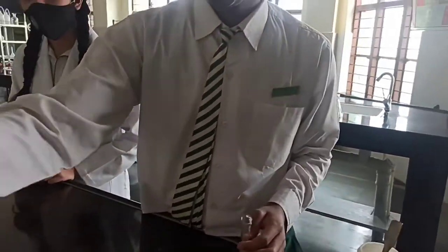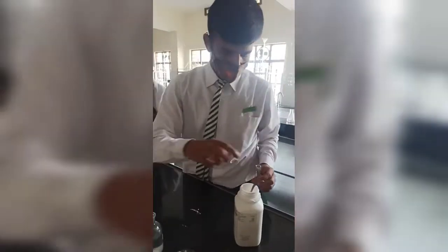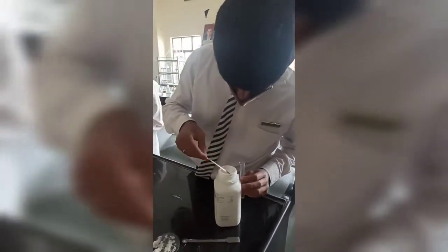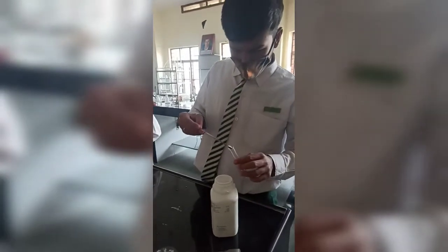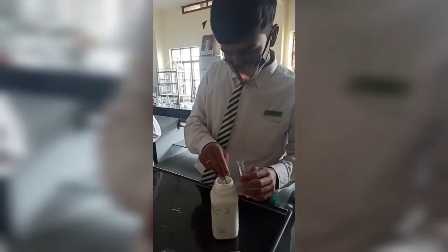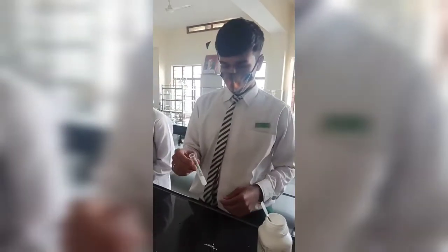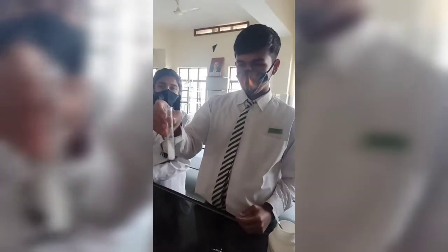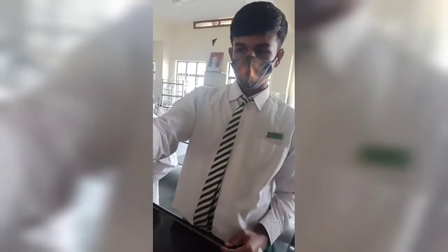Okay, now in the second portion of the aqueous solution, Mustafa you take the second portion of the solution, and in this test tube add magnesium sulfate, because the second test is the magnesium sulfate test. And what is going to happen with magnesium sulfate? If we get a white PPT, then carbonate is confirmed. So with dilute HCl, CO2 gas was evolved, brisk effervescence you have seen, and on passing through lime water, it turned milky, carbonate confirmed, first test. And second test, with magnesium sulfate, we get a white PPT in the cold solution. So this is the white PPT. I hope you have got it.